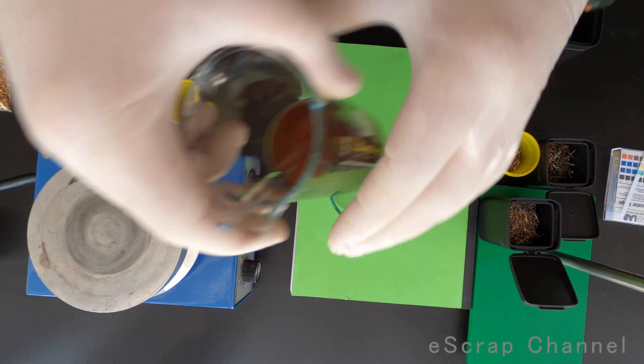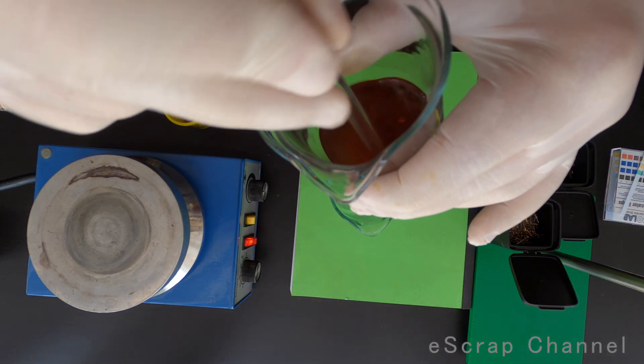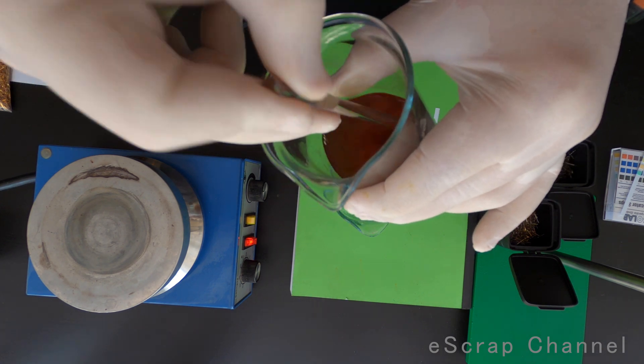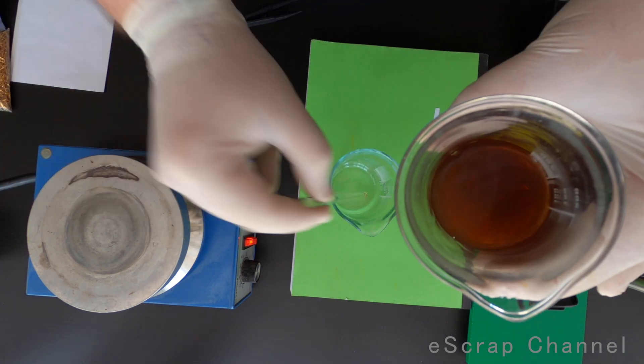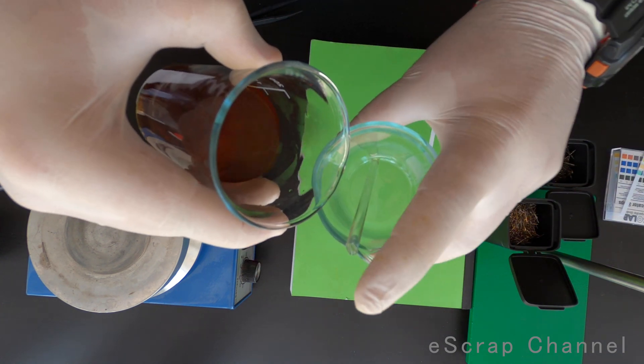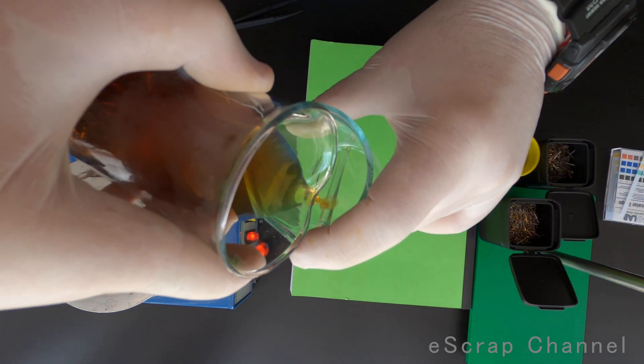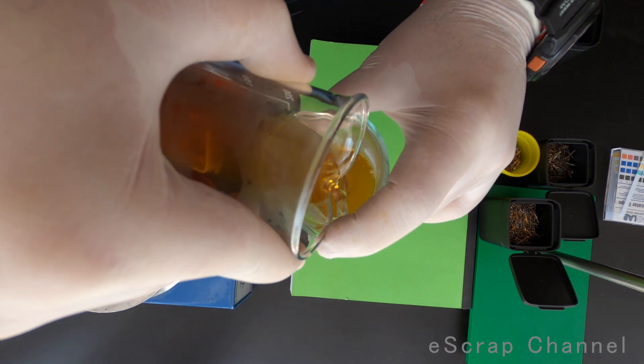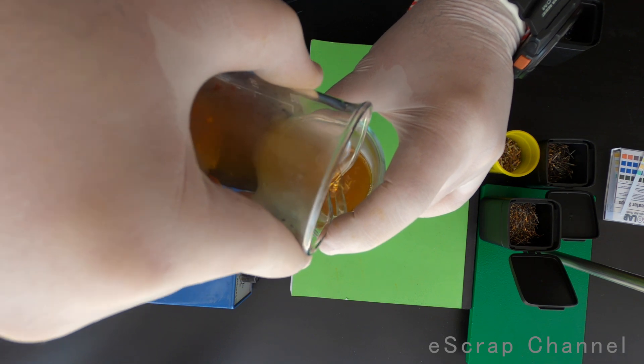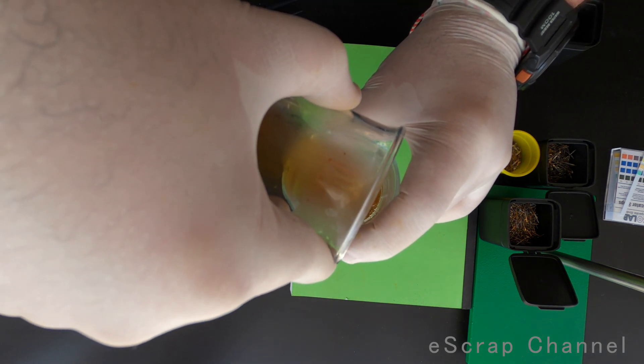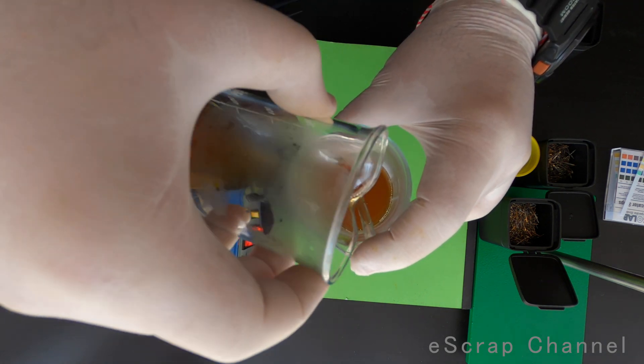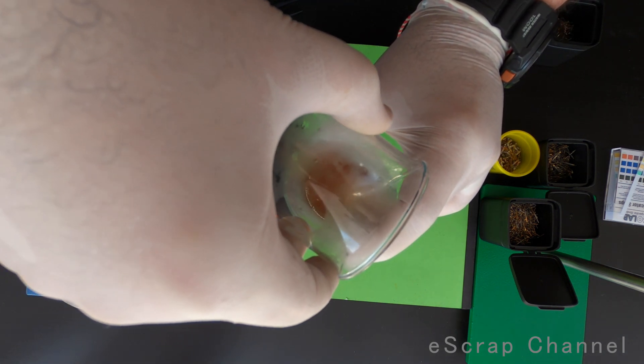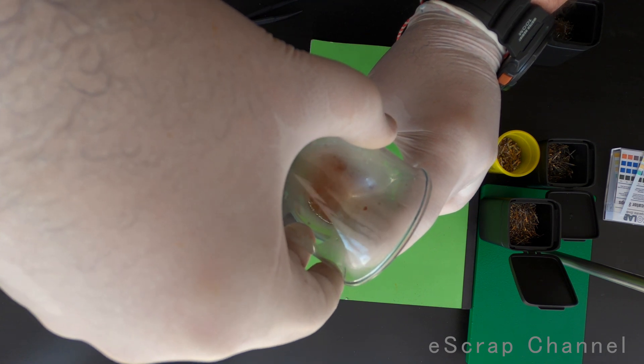I think it's time to end this process. It's about eight minutes after it started. Let's see what is left here. I will just transfer the solution like this. If you don't want to have splashes and drops around, always pour your solution on the stick. It smoothly goes from one beaker to another.